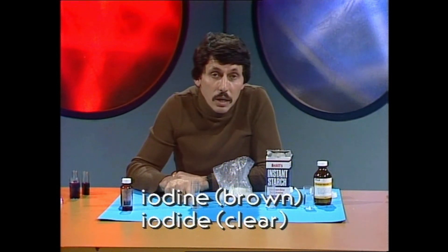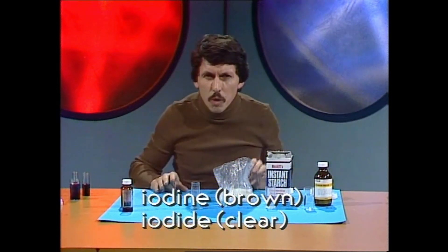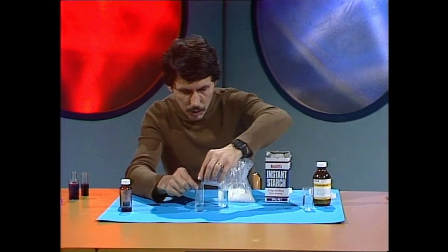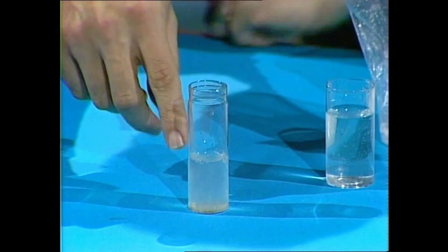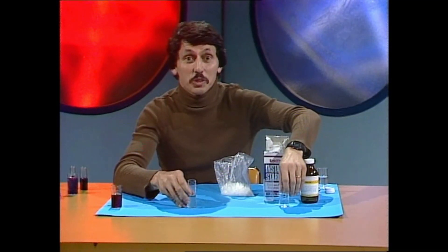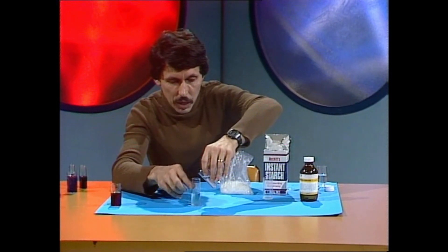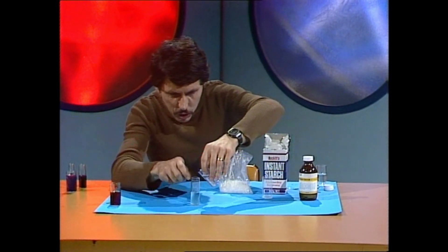At this point, the iodine — which is normally brown in solution — has changed to a clear substance called iodide, but the iodine is still there; it's just changed form. It's a bit like taking a room full of Christmas presents and wrapping them up in drab old brown paper — children coming into the room may not notice them. That's why you can add the starch to the solution, fill it up to about halfway with starch, and although you've got iodine there and starch, it's not going that blue-black color because the iodine is hidden.